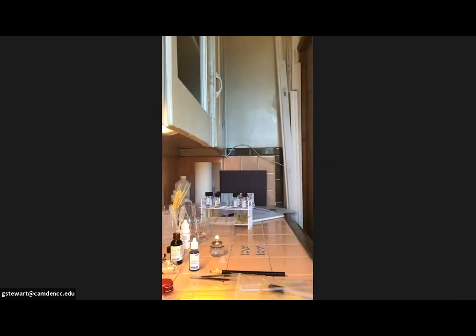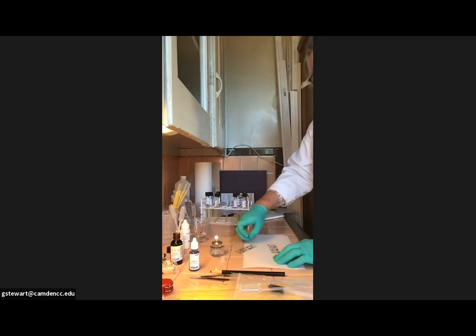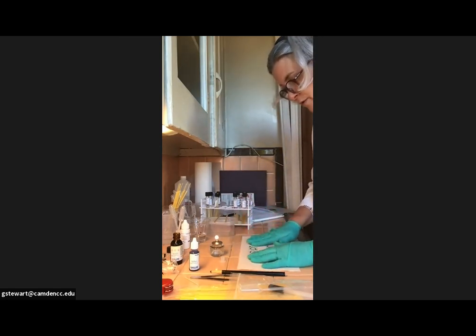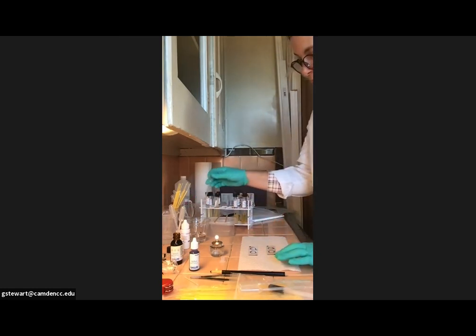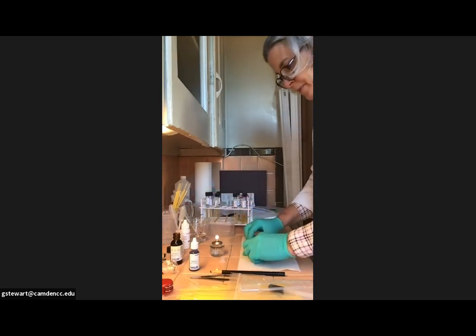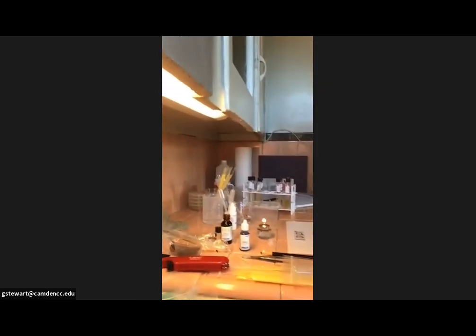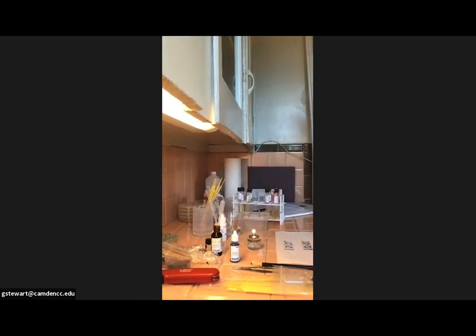If you're more comfortable with having a paper towel, I would do a single layer of paper towel just in case you had any problems with things dripping over. So on each of my slides, I'm going to place a single drop of distilled water, and I want this drop to be relatively small because the smaller the drop of water, the faster the slide's going to dry. So I am putting, and I'm just doing this on purpose, I'm showing examples of, I can bring the camera over so you can see. Right on that. So I have some small drops of water and then some that are large drops of water. But again, the smaller the better as far as the experiment goes.